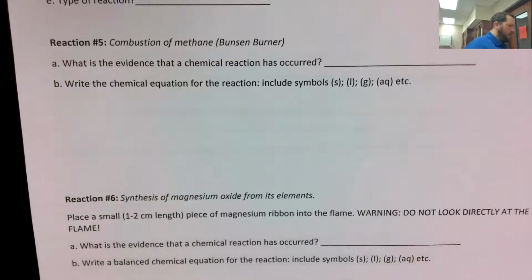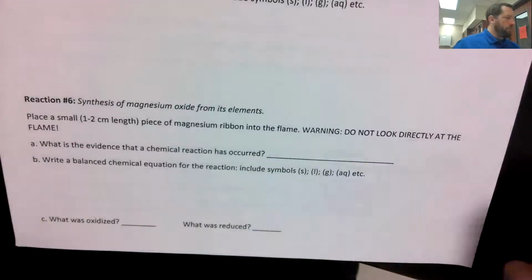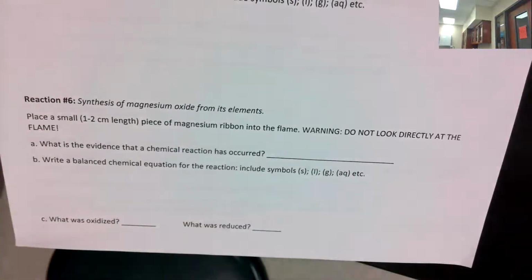And now we are ready for reaction number 5. And for this one, I feel terrible. Almost kind of want to re-record everything, but it's been going so well so far. I haven't been wearing goggles, and I feel like an idiot. I'm going to go get some, especially for this next part. So I'll be right back. Reaction number 5.